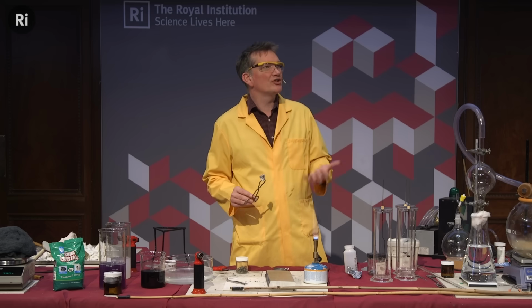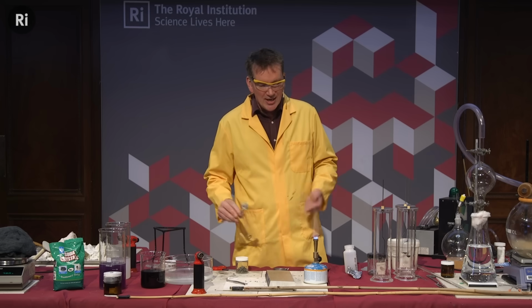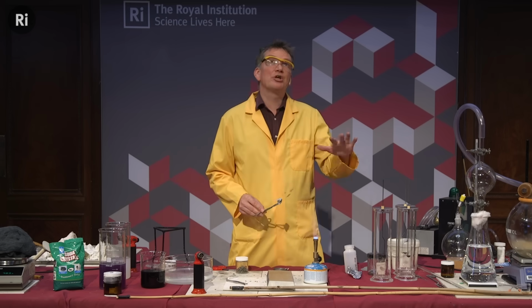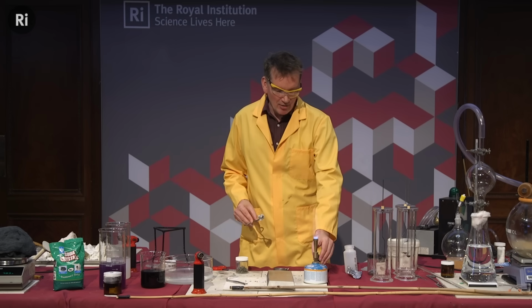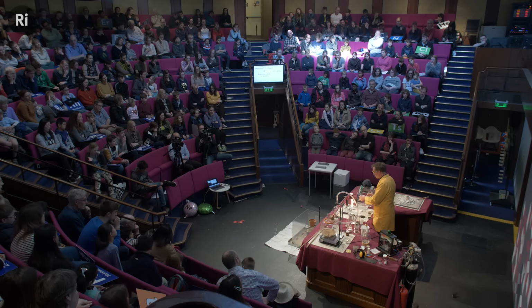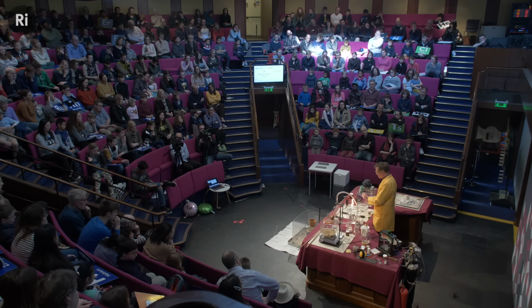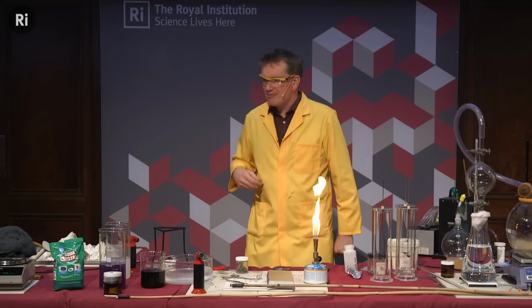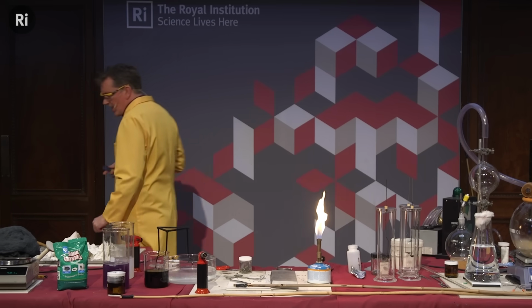If we have a large aluminium saucepan, it doesn't burn instantly. And again, it's because it's quite large, like this one, but it's also protected with a fine layer of the aluminium oxide. Well, it is forming the oxide, and so this probably has quite a bit of the oxide on it now. So we can form this oxide, and I'm going to try this in a different way.